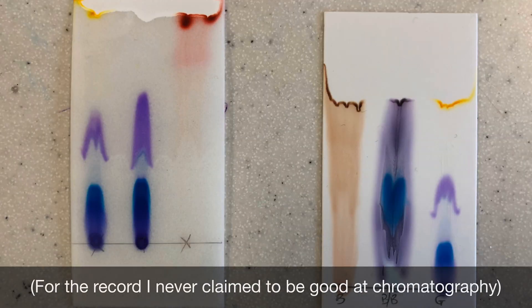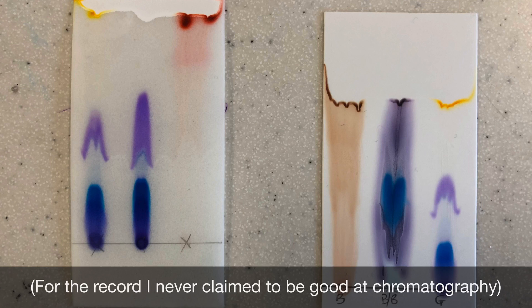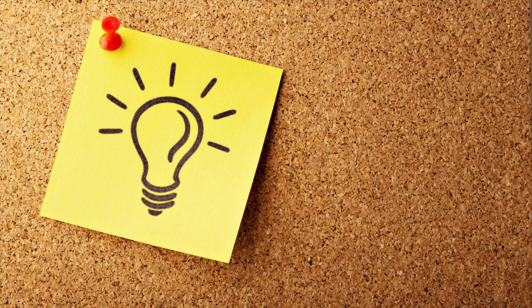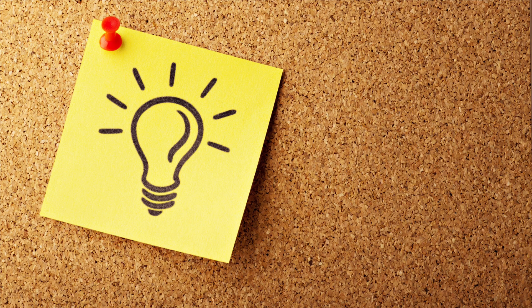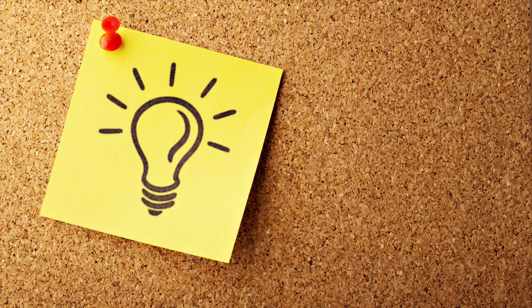Here's a still of the actual chromatograms I got at the end. I left one for a bit too long, but I really wanted to see how many different component spots there were in each mixture. This gives a general idea of what they look like, though in the exam you would be given really clear greyscale images to work with. Please click the links on screen to be taken to follow-up videos on chromatography, or click the i at the top of the screen for a relevant playlist or the TLC monitoring-the-progress-of-a-reaction video.